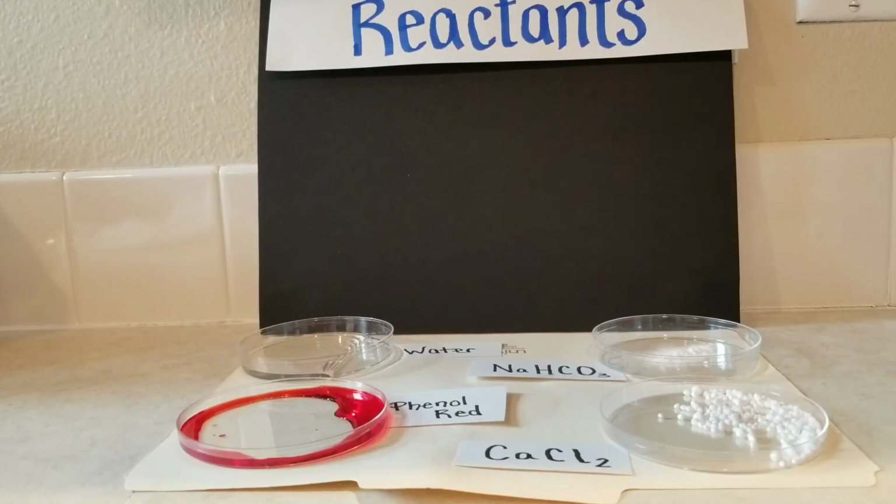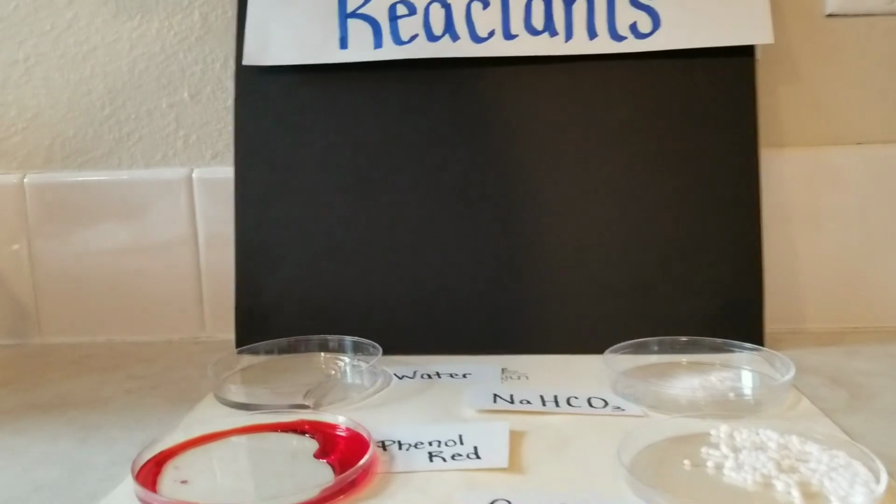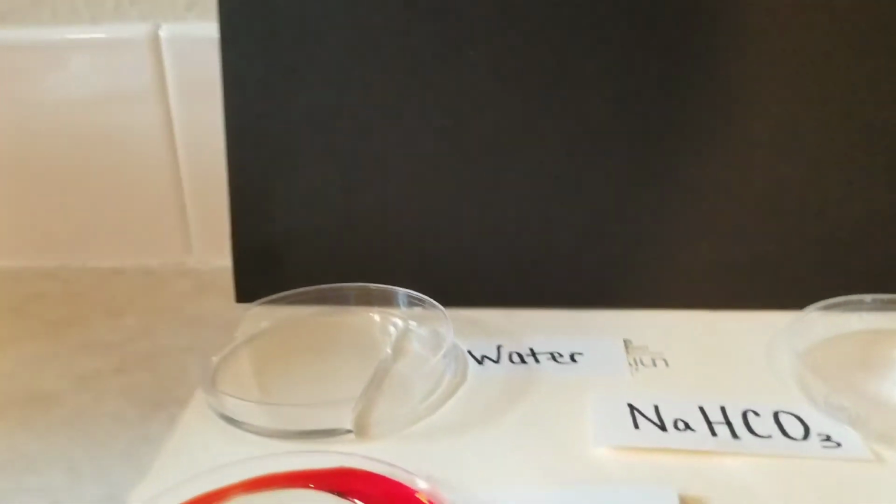The lab that we're going to look at today, there are 4 different reactants that will be combined together in different ways. I wanted to give you a chance to see the properties of each of the different substances before we started mixing anything together. So there are 2 solid substances and 2 liquids.